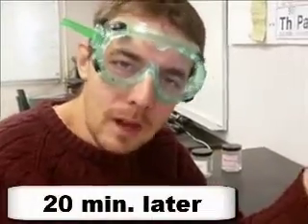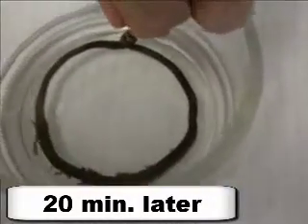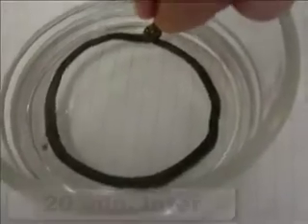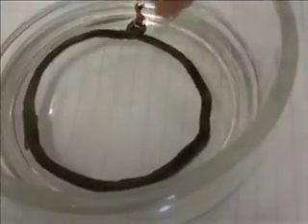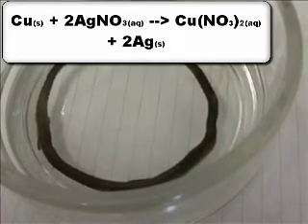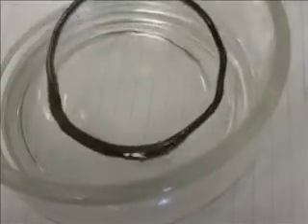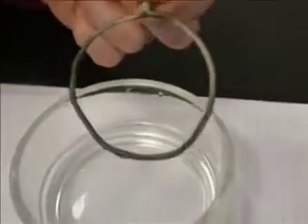All right, it's been about 20 minutes since we started our single replacement reaction. So let's take a look and see what we have here. You can see that a lot of the silver that was dissolved in that clear and colorless liquid came out of the solution. It replaced the copper. Some of the copper on the copper metal became copper ions, and then the silver ions in solution became silver metal in the single replacement reaction. So you can see it's actually coated with silver. Ooh, you can see really well there on the back side.